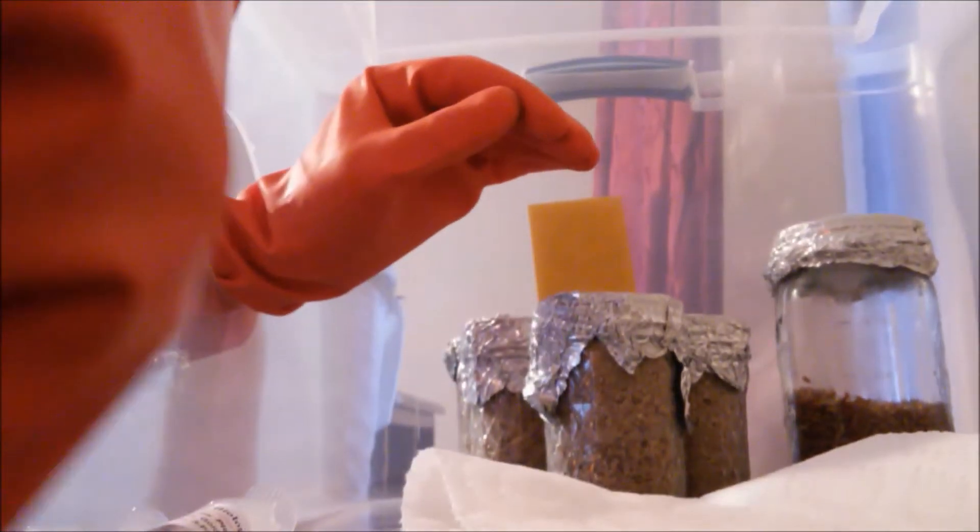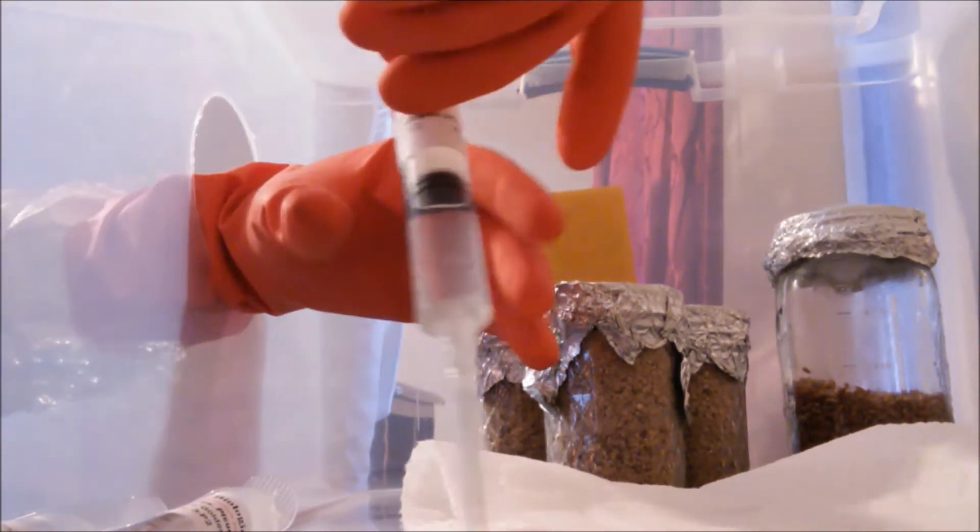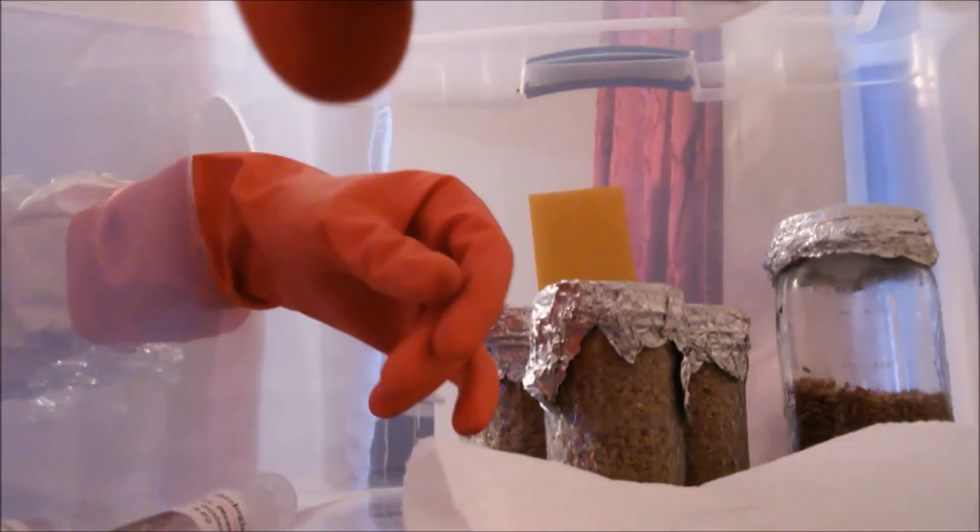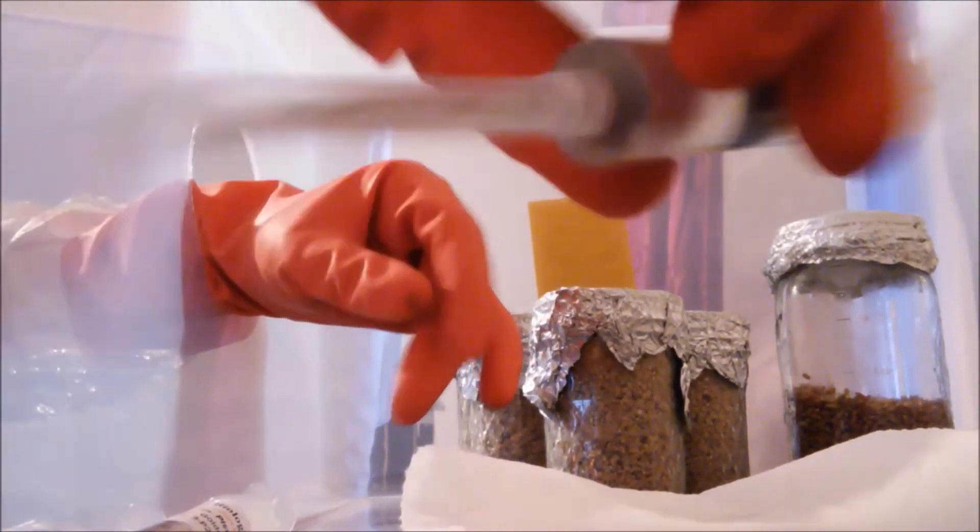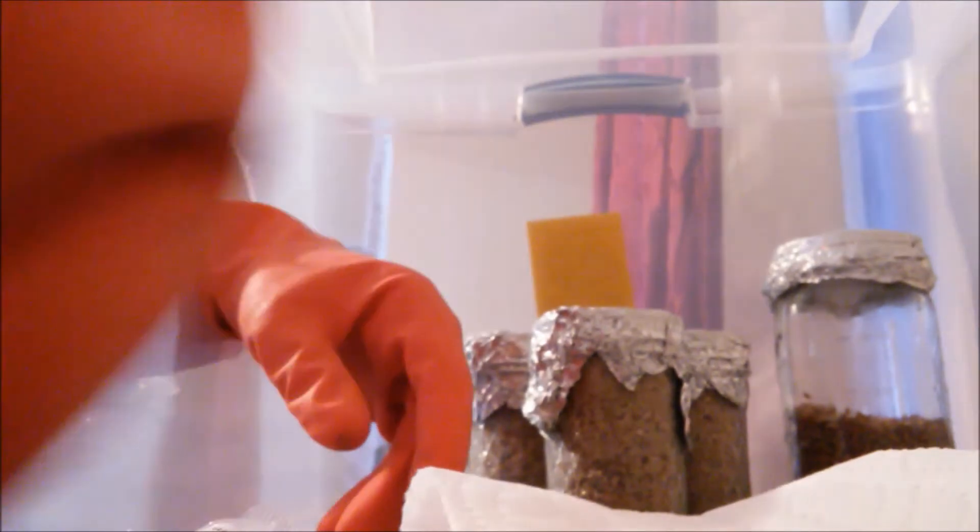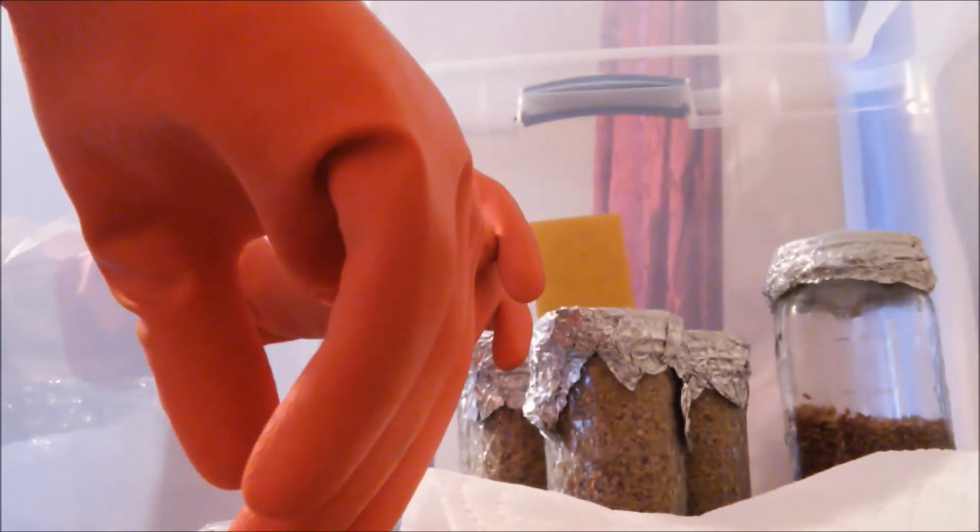And I don't know if you can see in the back but we have a grain jar and we're going to inoculate it with some Agaricon. I inoculated two grain jars with Agaricon a few weeks ago but I got hit with some lipstick mold, so that wasn't fun.